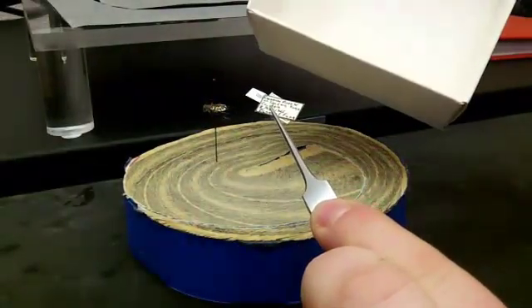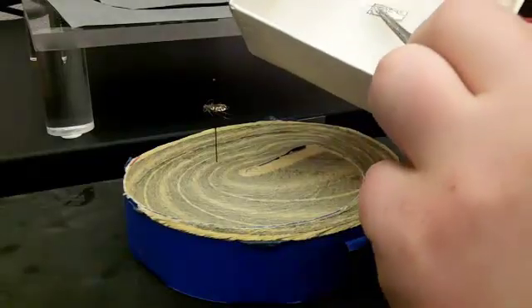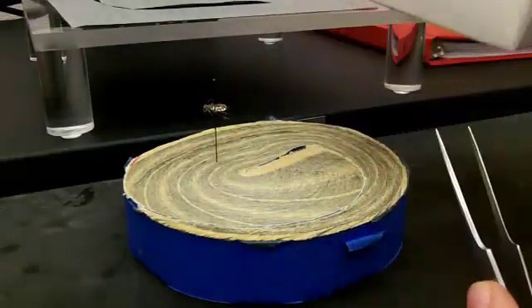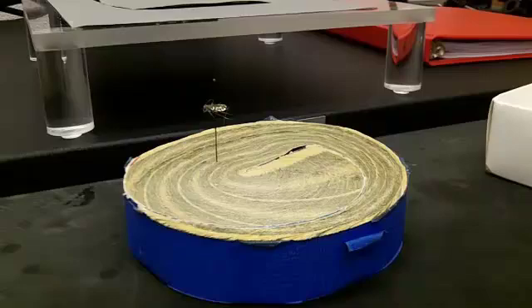The thing to remember is to always put your labels in the specimen's unit tray. This keeps everything together and prevents mixing up labels and specimens.